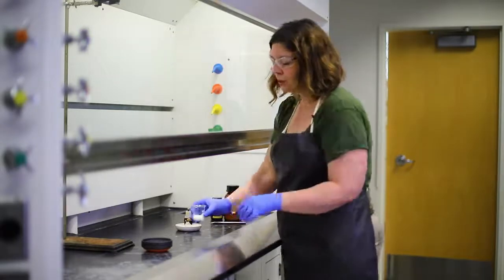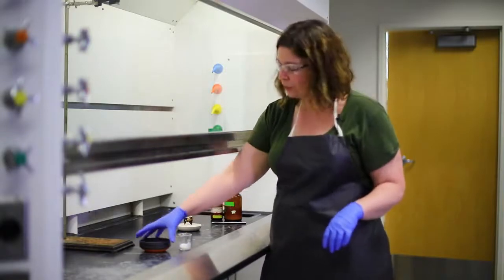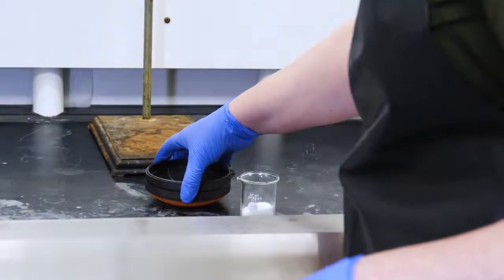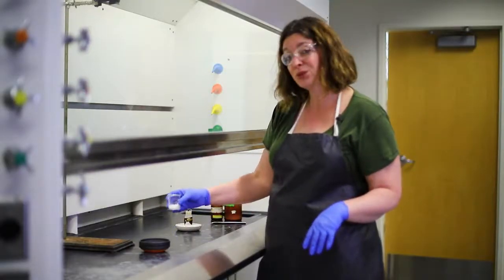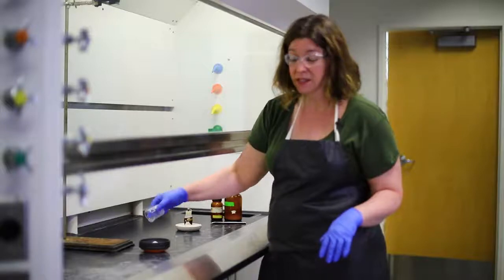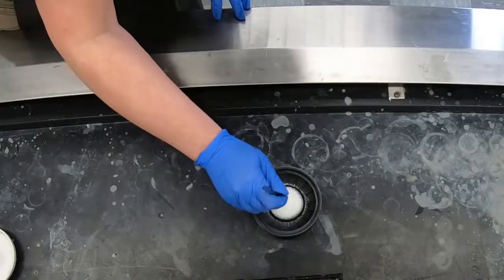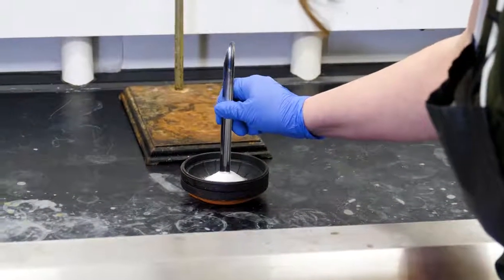And then we're going to show you that you can do chemistry with things other than chemistry glassware. We're going to use clay pigeons. We're going to use a stack of 2 clay pigeons. And we're going to use these because they crack nicely. This is going to produce so much heat that it's probably going to crack. And they're very inexpensive. And they're a little easier to clean up than broken glassware. The last thing I'm going to do is make a little bit of a well.